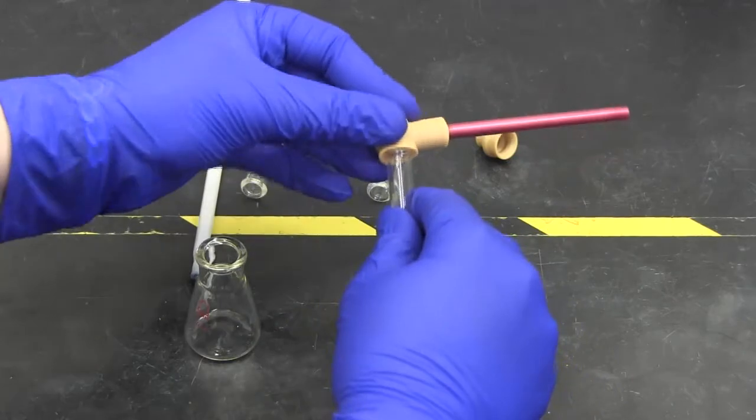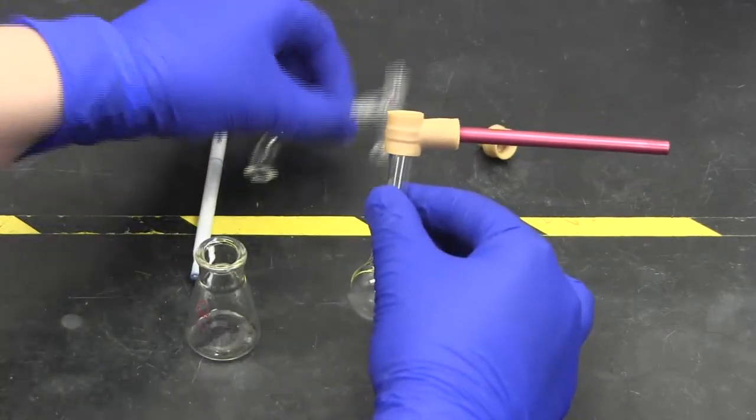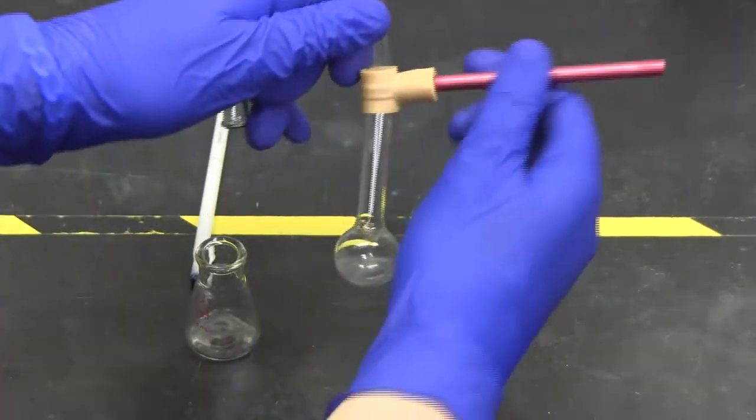Set up the distillation kit, making sure the rubber fittings are snug. Follow the diagram provided in your lab binder.